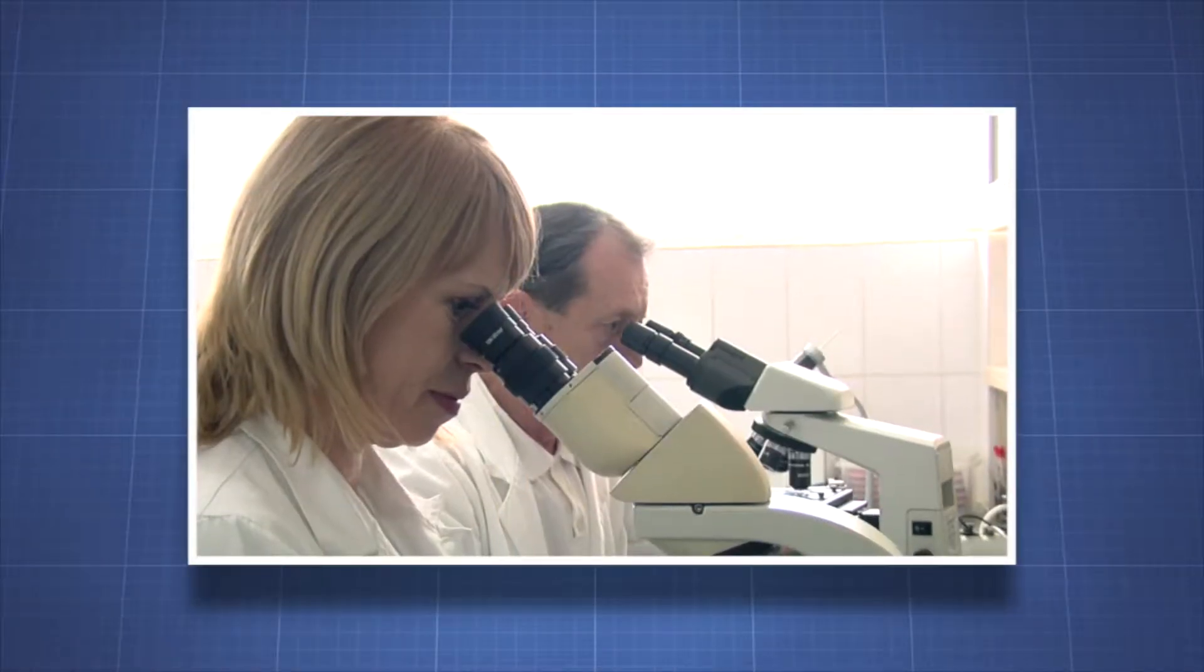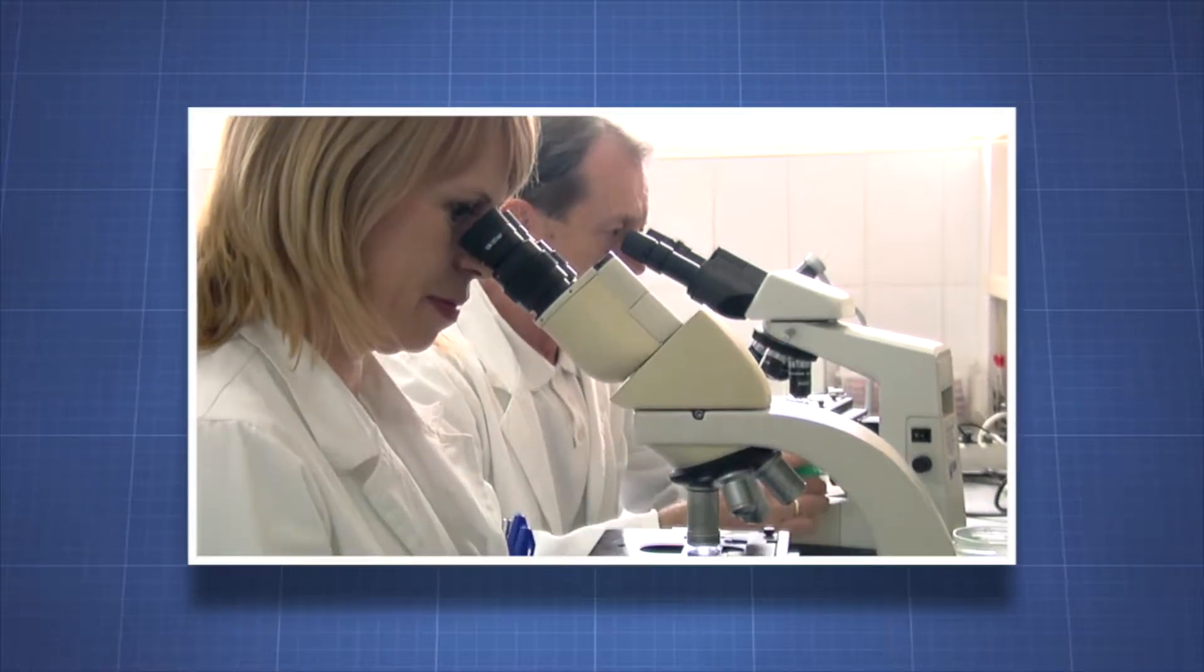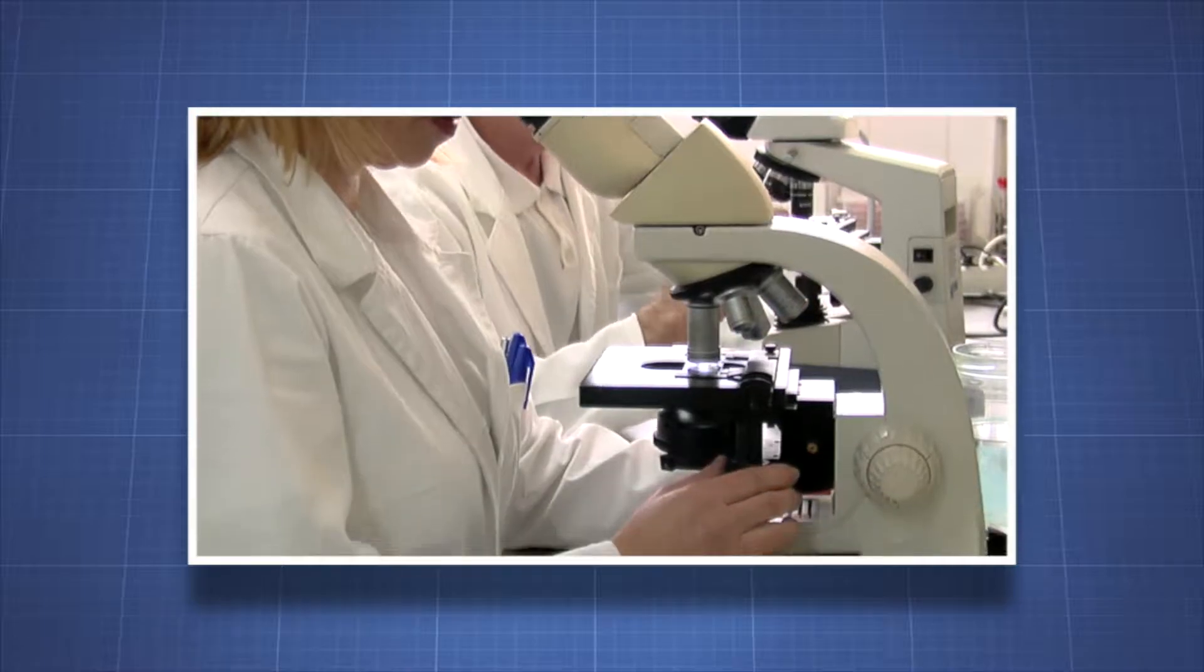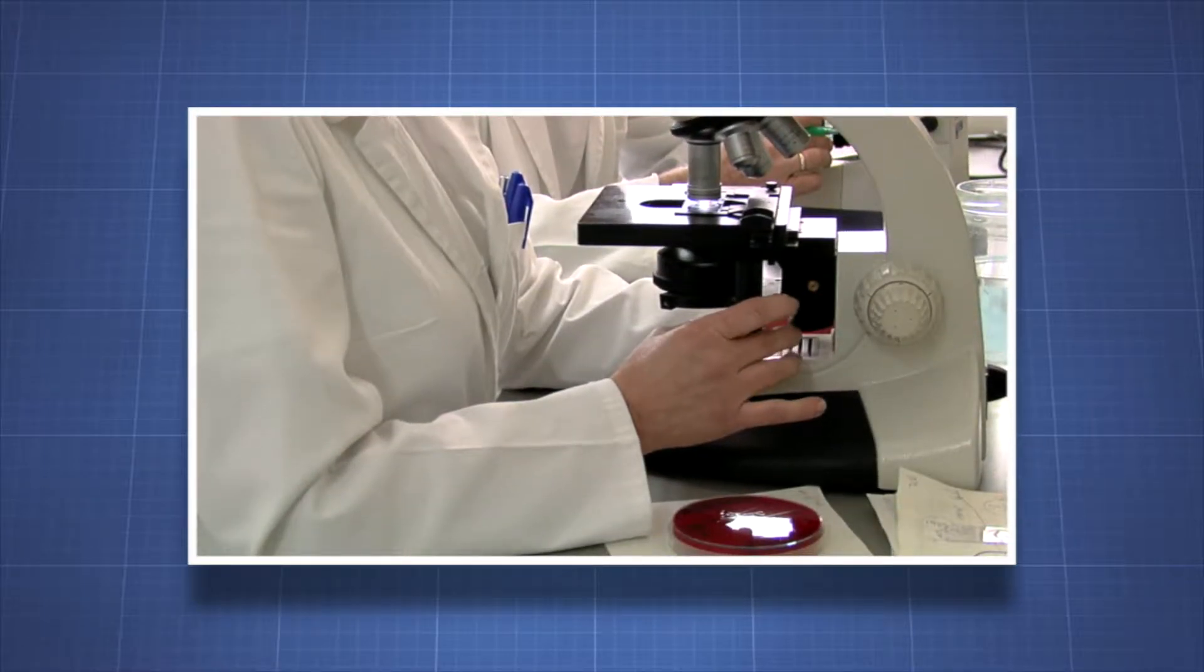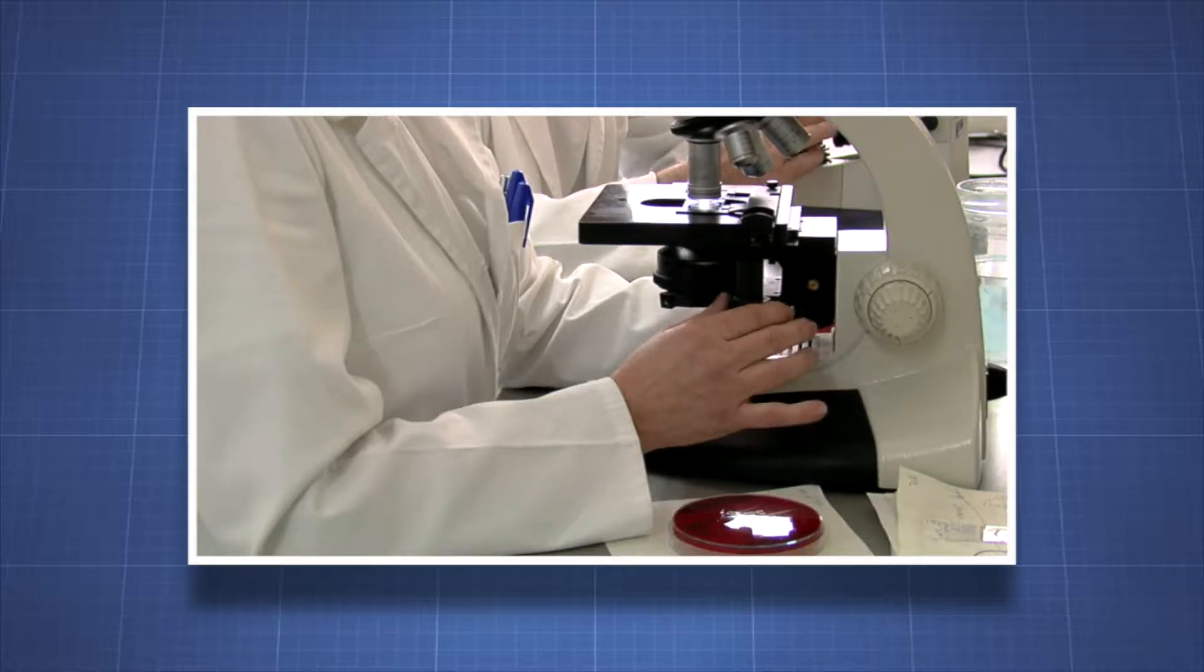Scientists use microscopes to observe structures and organisms too small to be seen by the human eye. For the best possible images, the scientist uses specific methods to prepare and observe a microscope slide.